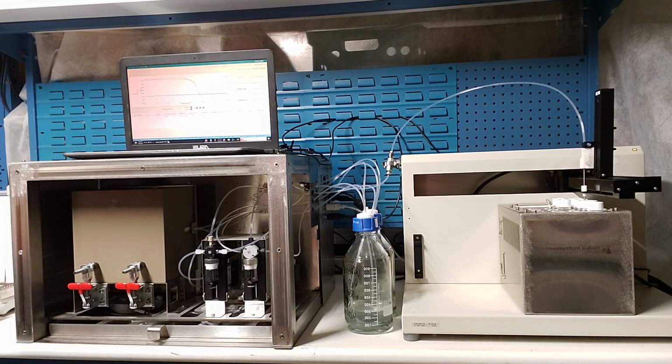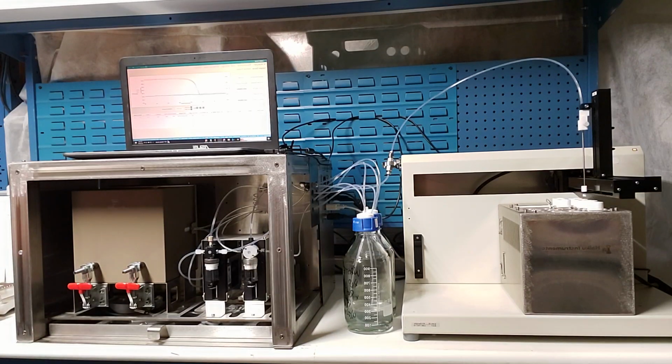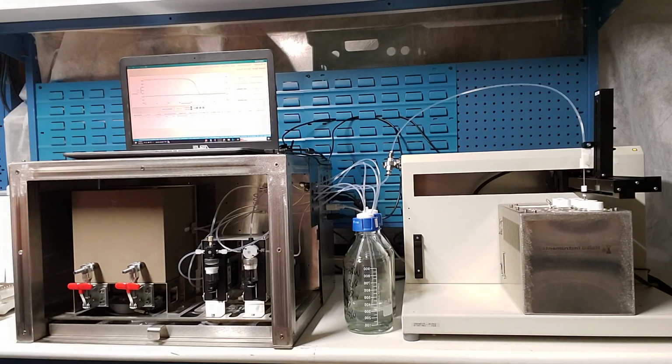You can see what we're doing is drawing some sample from the vial, drawing an air segment, and then again sipping back into the vial. This allows us to prevent carryover. So it doesn't matter if we run high intrinsic viscosity samples first and then go to low, or low to high. We wash the injection system with the sample before the injection, and then the capillaries are washed automatically by the system during this loading period. Some samples can be run in this fashion. Others that have a higher affinity for the capillary material require us to run in this classic mode.